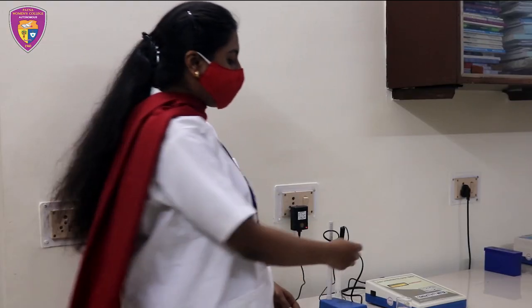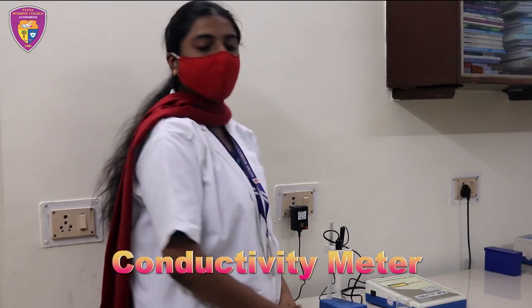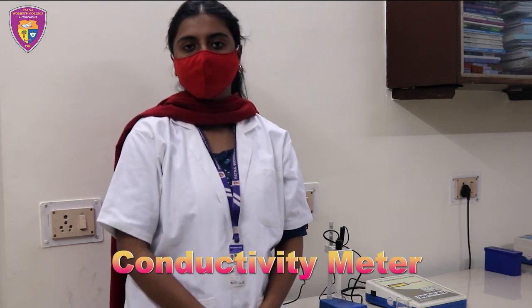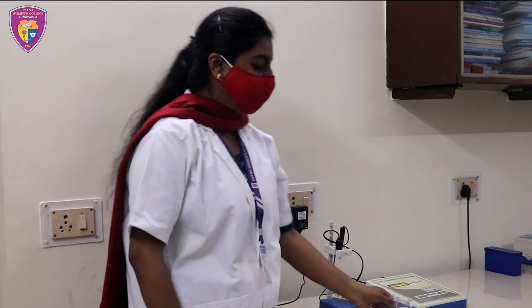This instrument is called a conductivity meter. A conductivity meter is a device used to measure electrical current or conductance in a solution. The probes of the conductivity meter are made up of platinum. Right now I am measuring the conductivity of the sample.